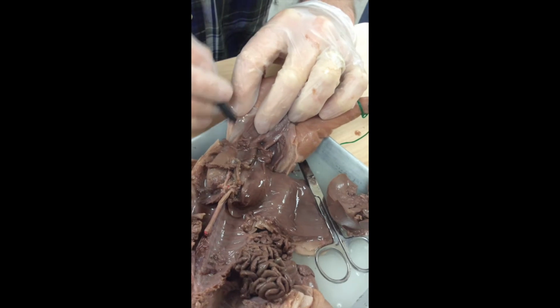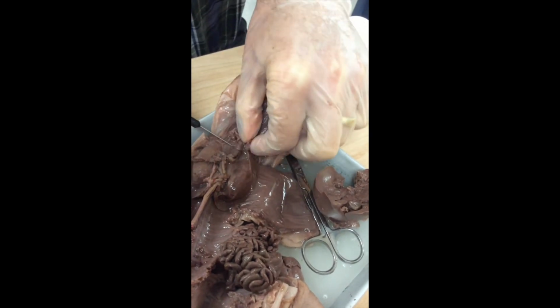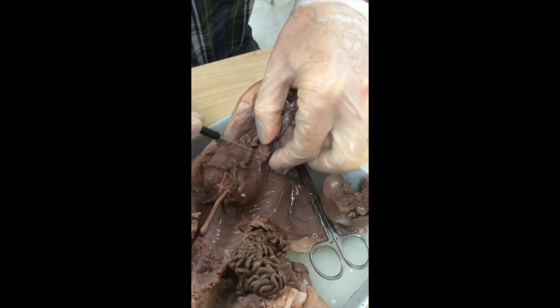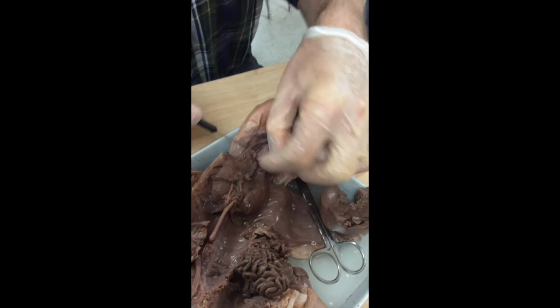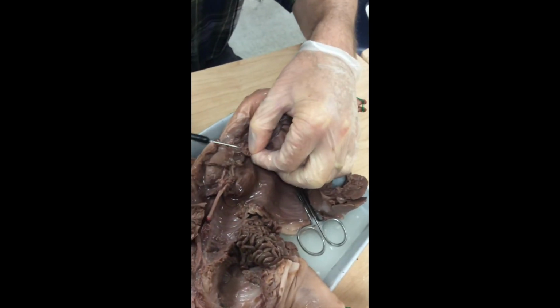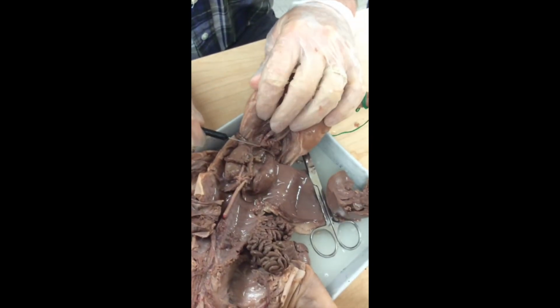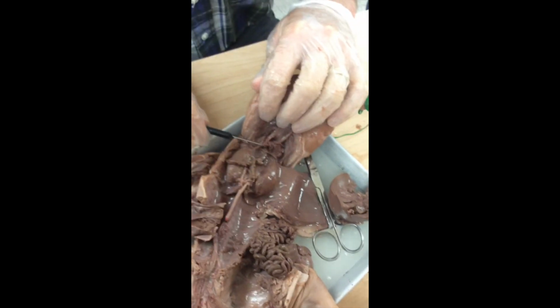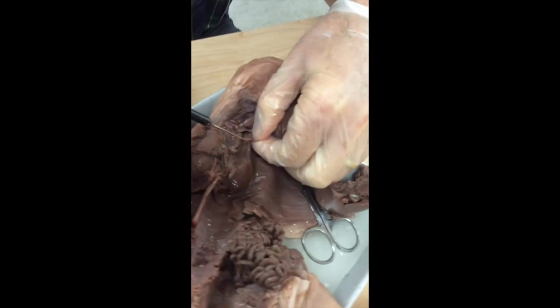It's kind of like a V shape. Well, there's the uterus of this pig. Winging off right in there. And sitting right here, we have an ovary. And there's an ovary on the other side over here. A little difficult to see.